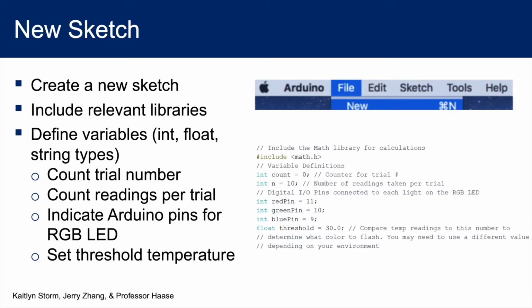Let's start with the software. Create a new sketch. We will always begin by including libraries and defining variables. Libraries are collections of helpful functions that we can use. So if you include the math library, we can use functions like calculating square roots. Next, let's define some variables which can help store helpful information.